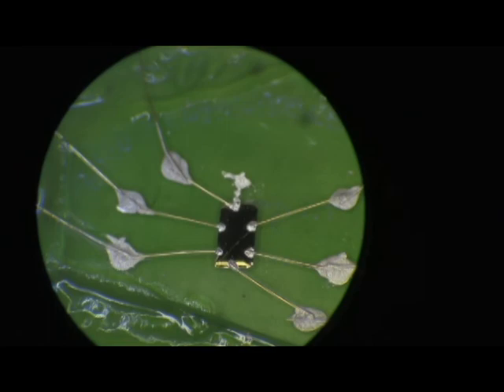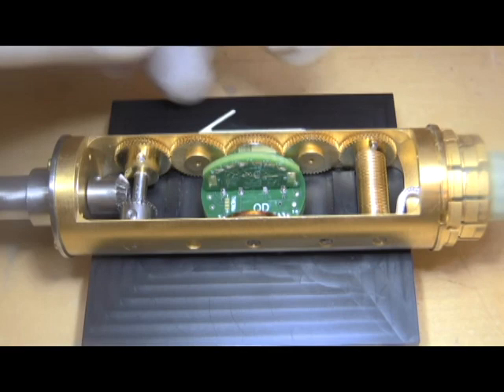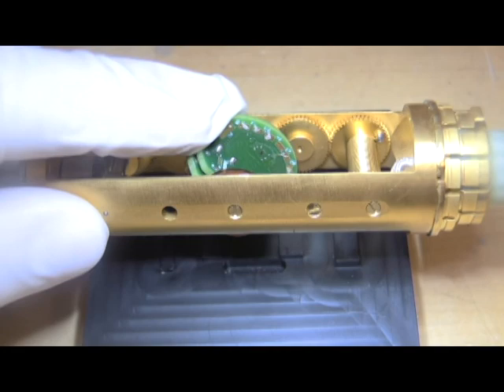The finished crystal is carefully adhered to a small puck and put in electrical contact. The puck is then connected to a special rod which is inserted into the cryostat. This rod allows the crystal to be rotated so that the magnetic field of the cryostat can touch the crystal at different angles.